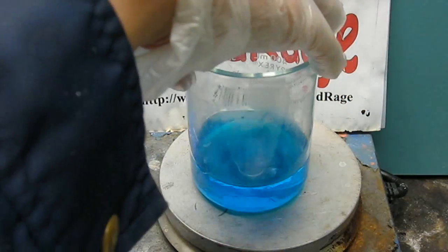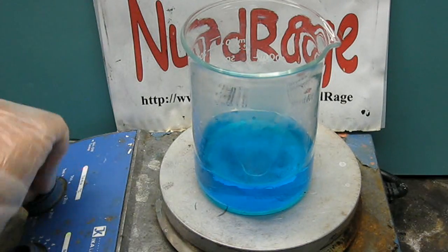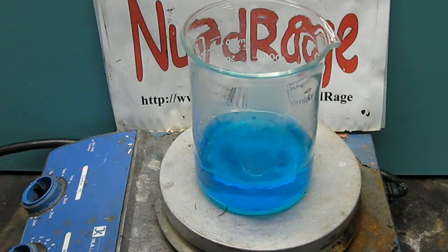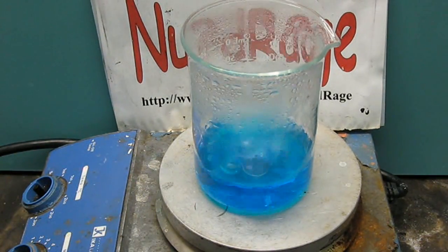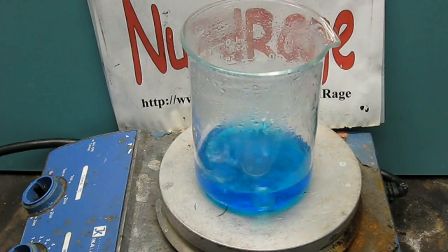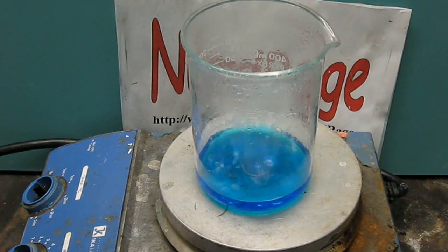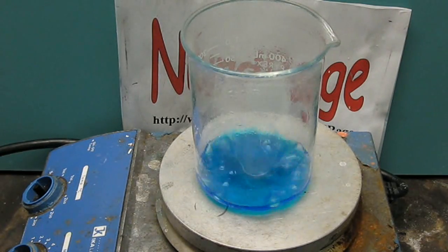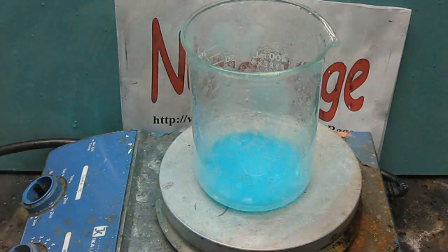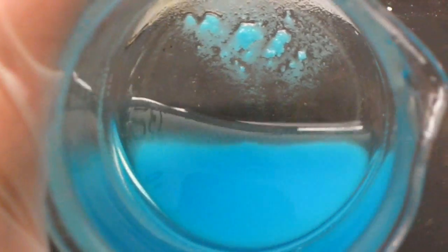Alright, no matter how you make it, to get your solid copper sulfate you can boil down the mixture. Since there is going to be excess sulfuric acid the mixture will never boil completely dry. But the copper sulfate will precipitate out right about now. Here is the fine copper sulfate powder in the sulfuric acid. Just filter it off and recycle the acid to make more copper sulfate.